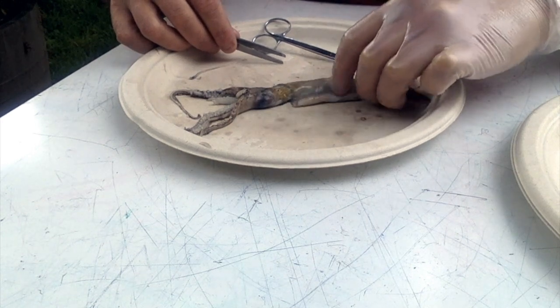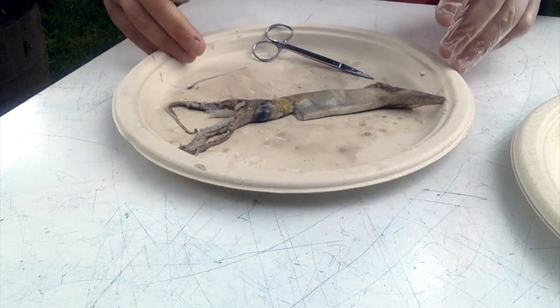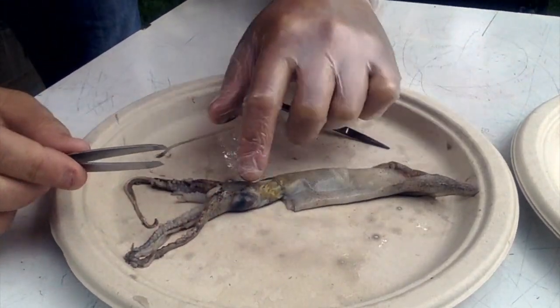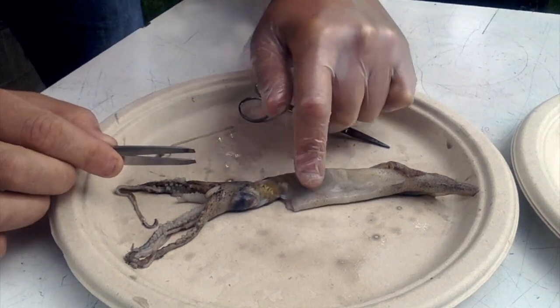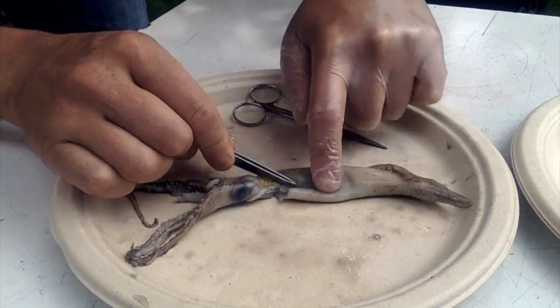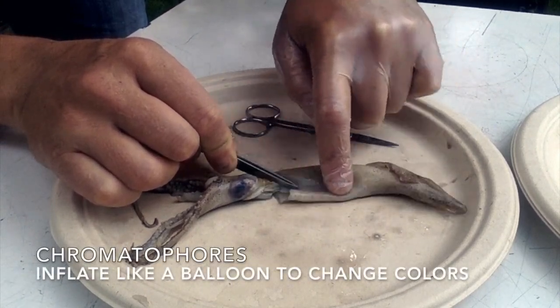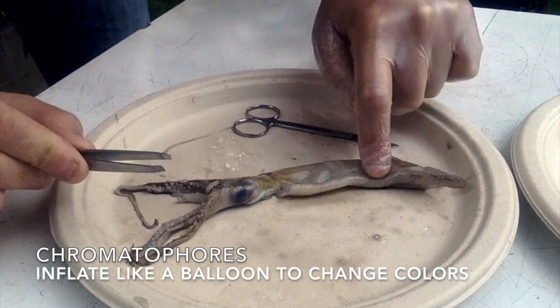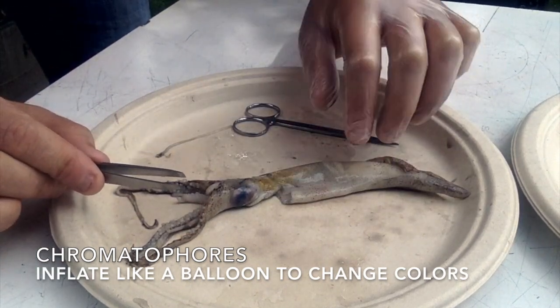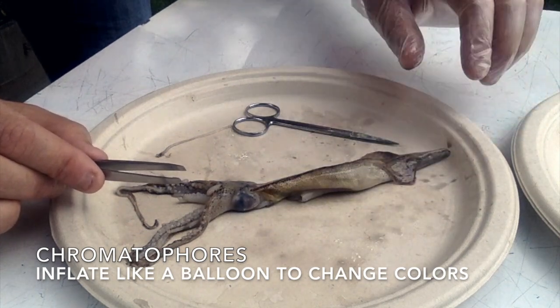I'm not seeing a whole lot of change, but these tiny little spots on the surface of the mantle, really the whole body, those are called the chromatophores. And when we rub these, they do change colors. Yeah, now I'm getting more pink color in here. And so by changing size, these little cells, or sometimes they're referred to as mini organs, actually, will change color.